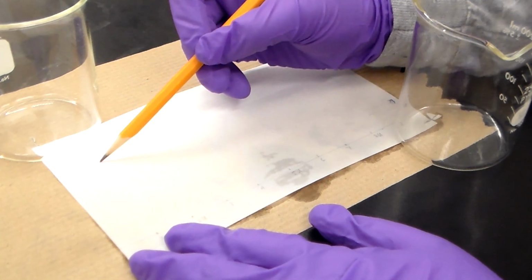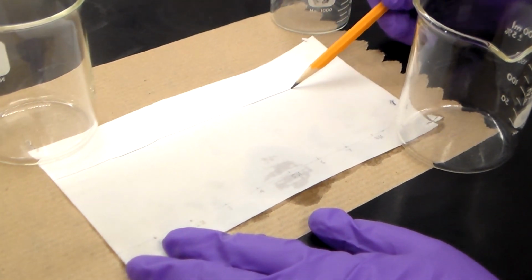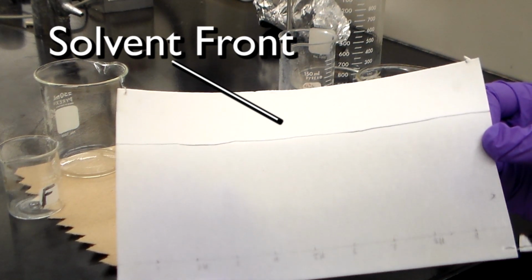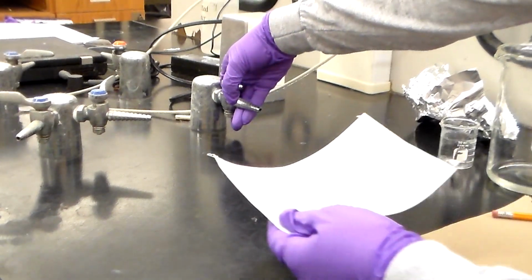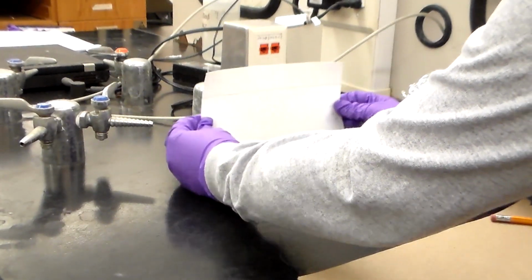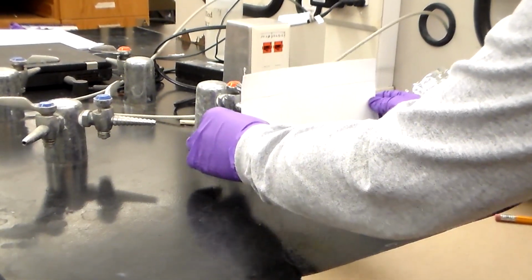After 30 minutes, take the piece of paper out of the chamber and mark the solvent front with the pencil. The solvent front is the farthest distance that the solvent has traveled. Remove the staples and lay it flat on a paper towel to dry. To speed up the drying process, you can blow lab air onto the paper. Again, be sure that you have marked the solvent front before you dry the paper.